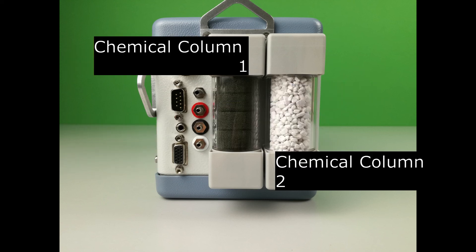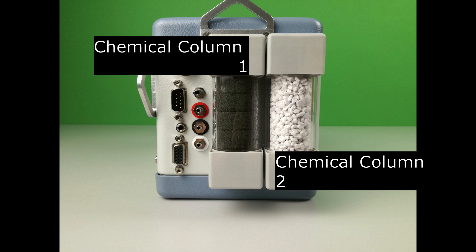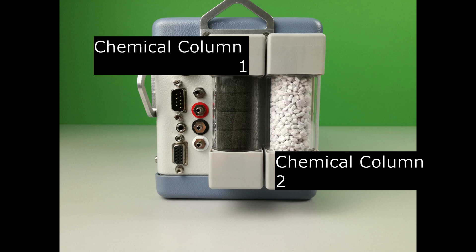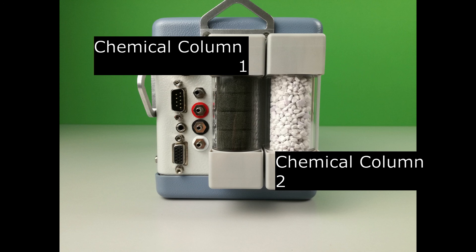Chemical column 1 is filled with buffer foam and should be installed as it is supplied. Column 2 should always be filled with fresh white soda lime, two jars of which are supplied in the spares kit with LCIT.